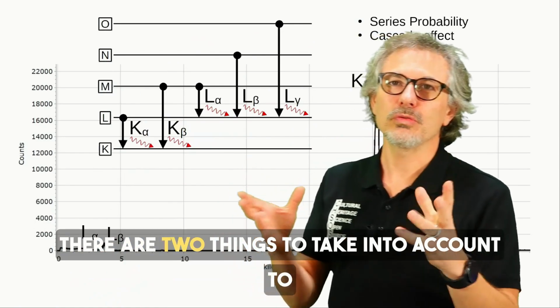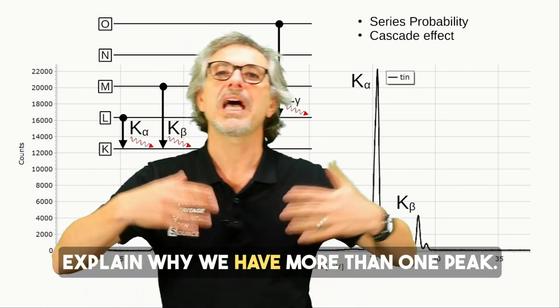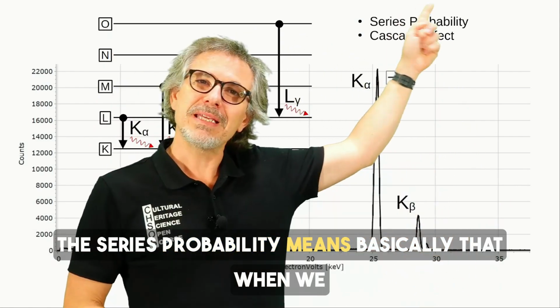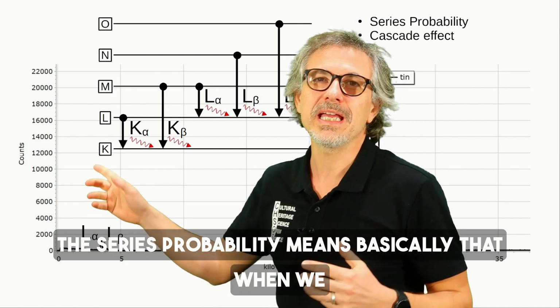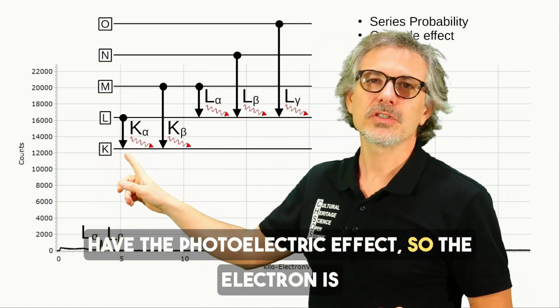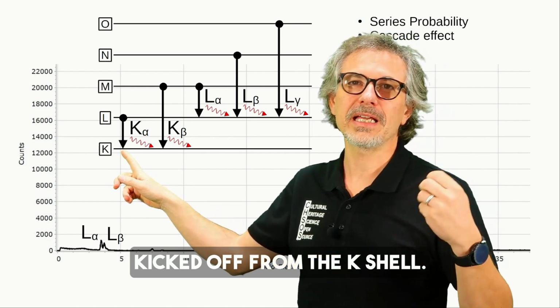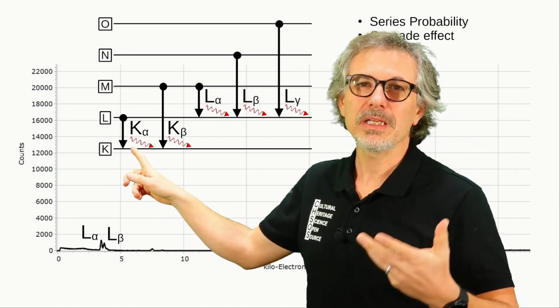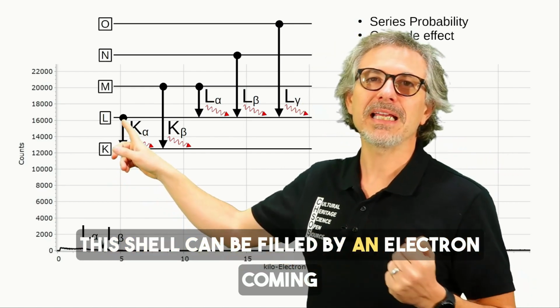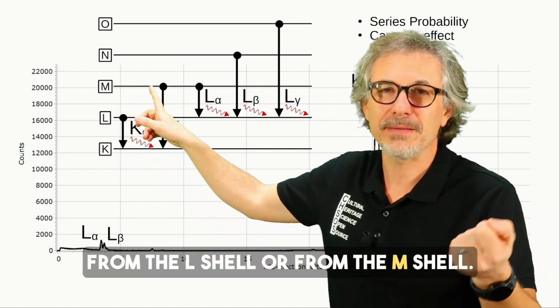There are two things to take into account to explain why we have more than one peak. The series probability means basically that when we have the photoelectric effect, so the electron is kicked off from the K shell, this shell can be filled by an electron coming from the L shell or from the M shell.